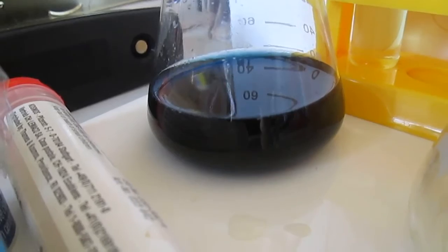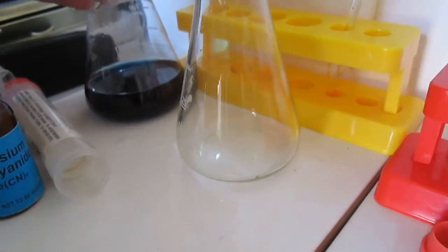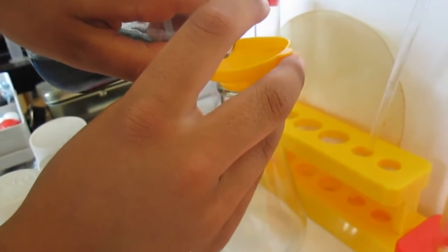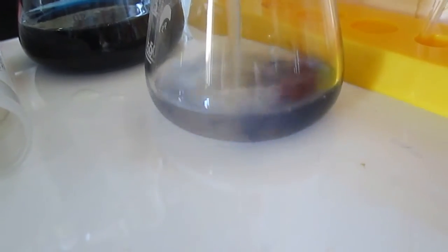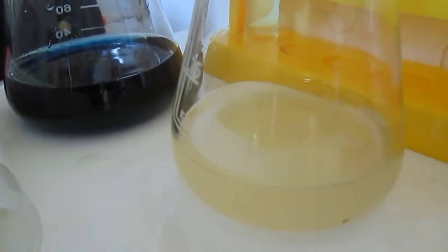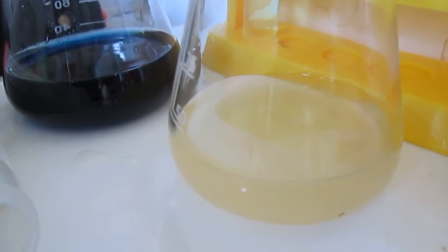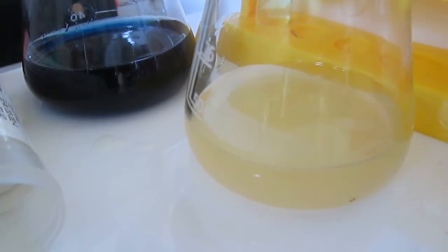We will now pour the sodium carbonate on a little of the blue. The blue pigment disappears as we add the sodium carbonate. This is because we have made the solution very alkaline with the addition of sodium carbonate and the Prussian blue becomes unstable in an alkaline environment.